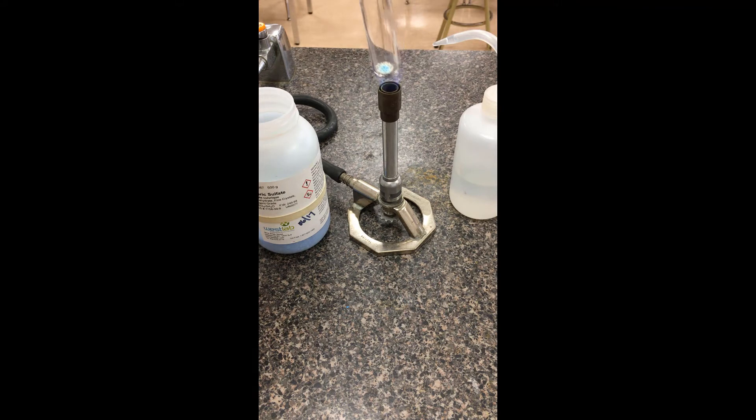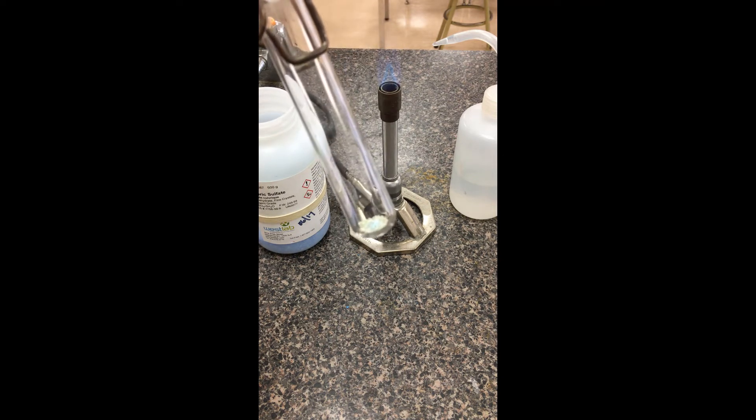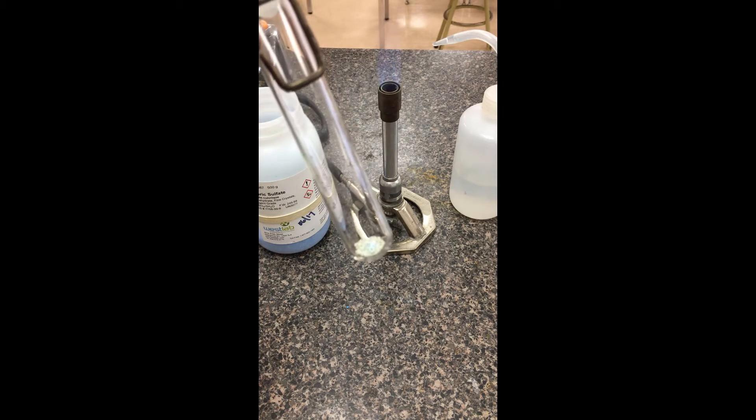So just heating it there. So definitely losing that blue coloration there. We're actually maybe even charring a little bit of the powder. So there we go. I'm just going to take it off the heat source.